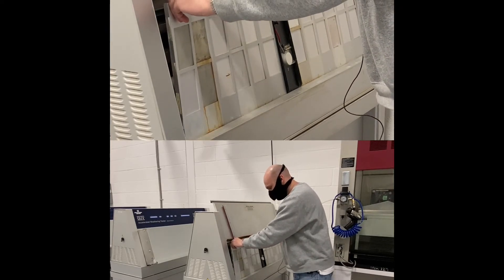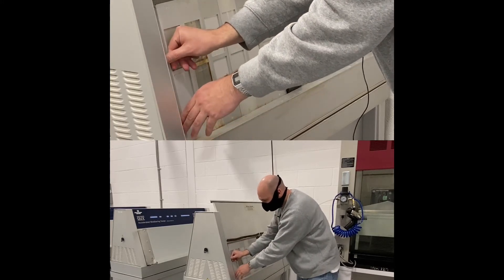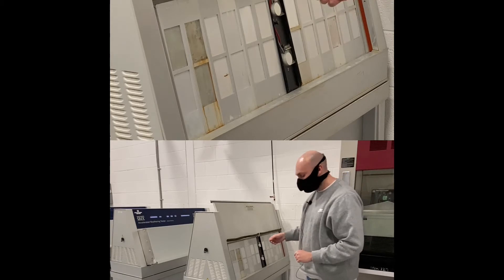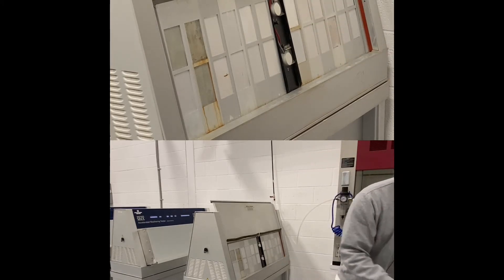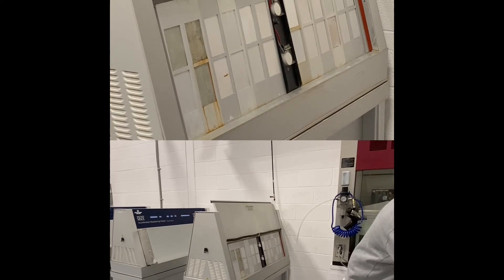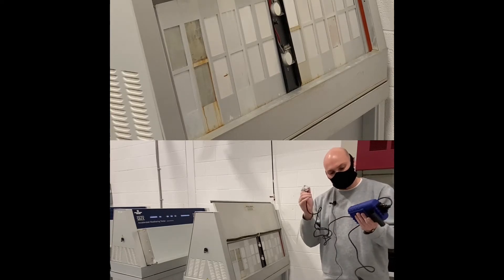These are the sample holders — this is the rack. The samples are facing the fluorescent lamps. There is no calibration needed for the lamp display itself; all the technology is in the sensor.